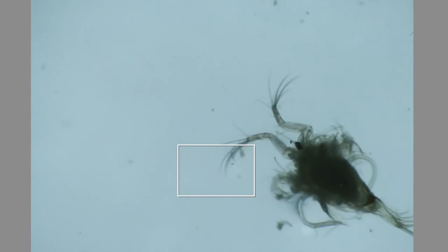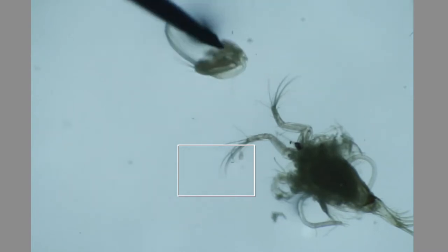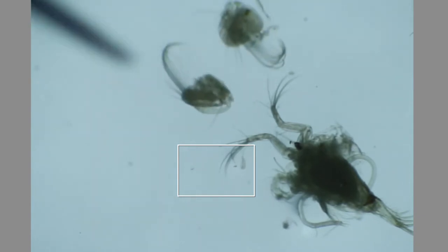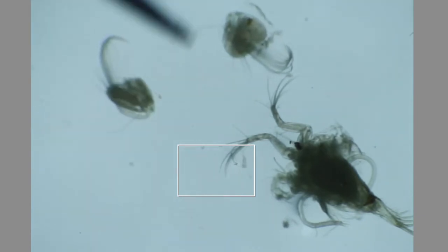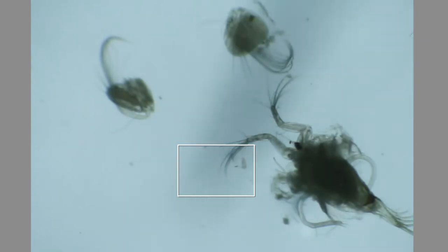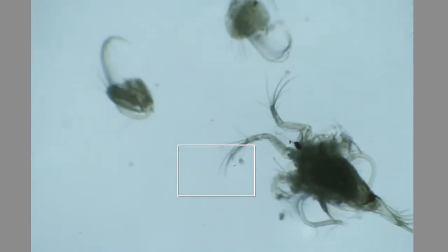It's going to work for our purposes today. Most of the animals you get shouldn't be quite that old. So we have our two second antennas. Often at this point, you're actually going to take one of these second antennas and put it back into ethanol — that's if you're going to extract DNA. So if you're doing the morphology project, you're going to keep one of these second antennas.